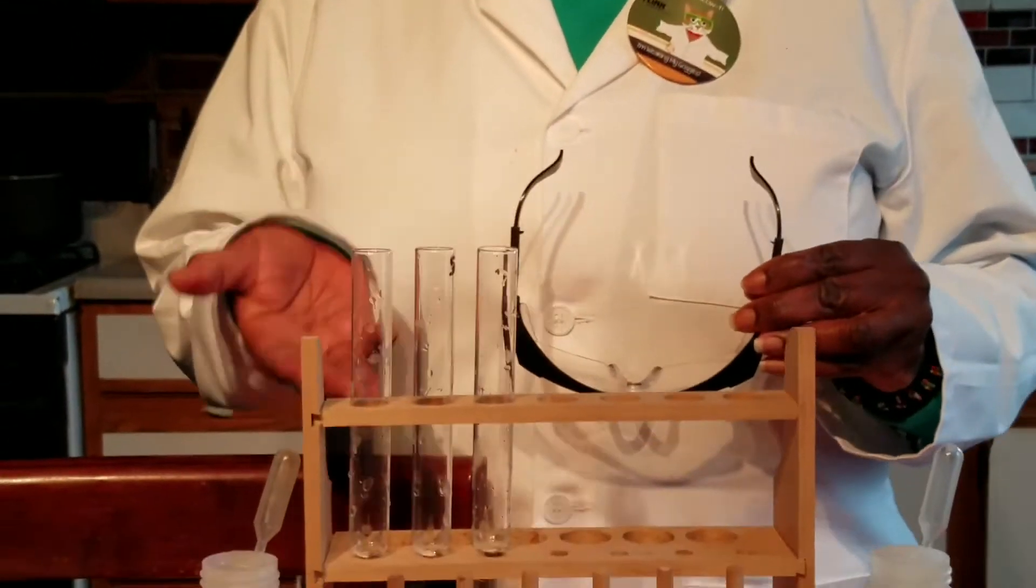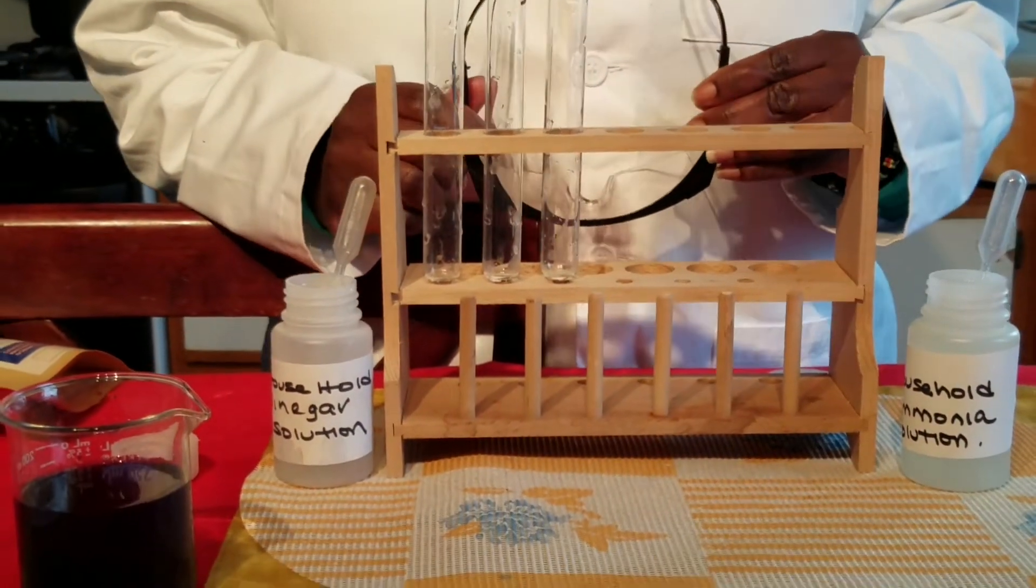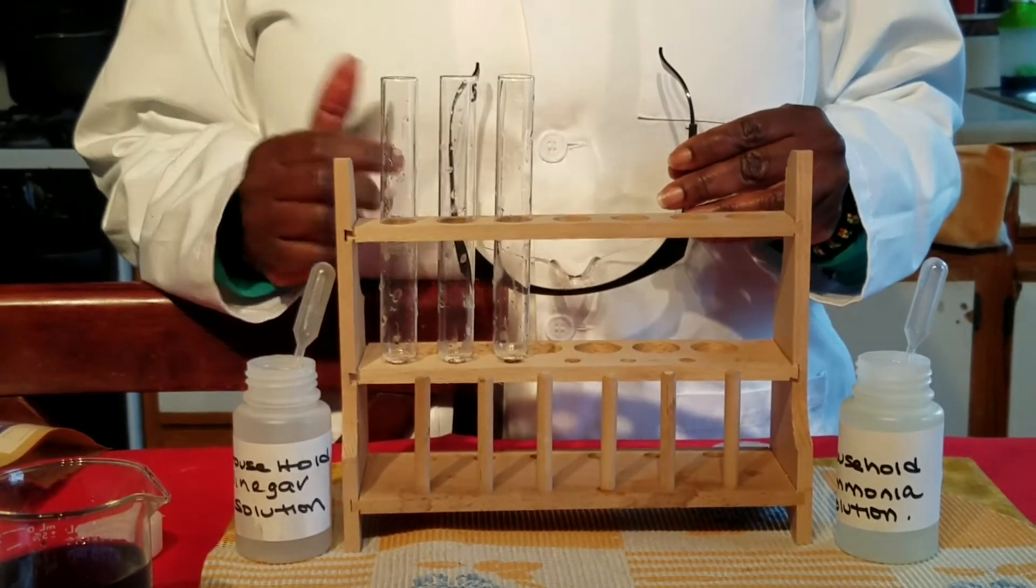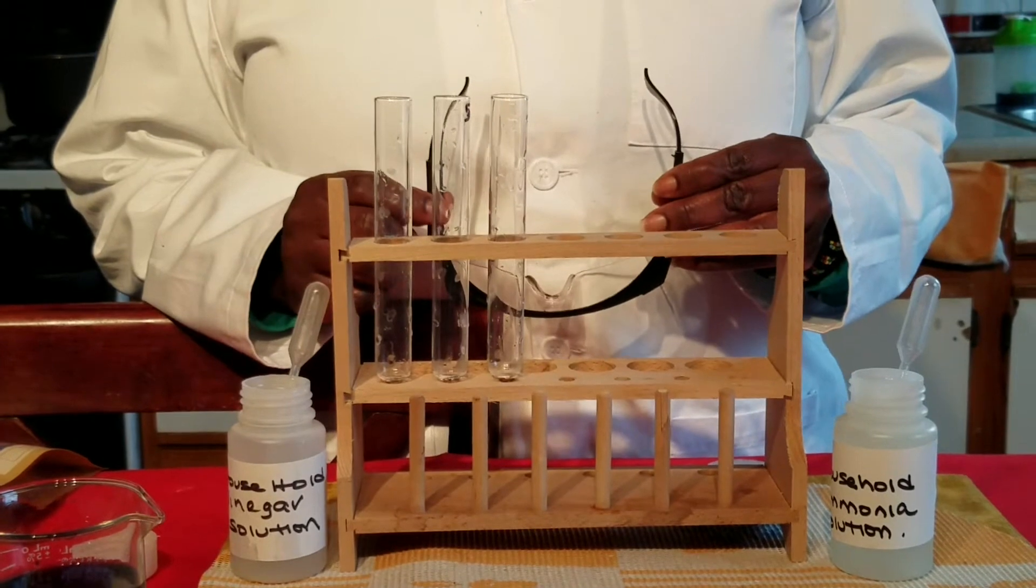We're going to be doing another lab which has to do with equilibrium. Last class we did an activity where we showed that equilibrium was a state of balance. But what would happen if a stress was applied to that equilibrium?